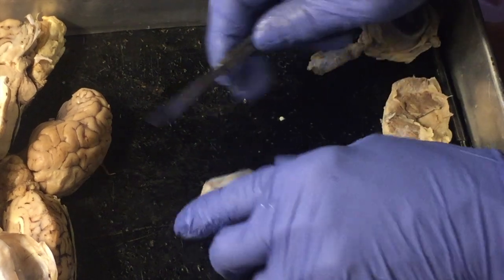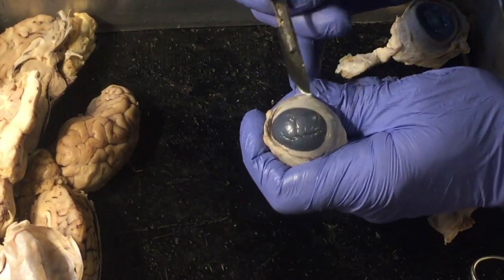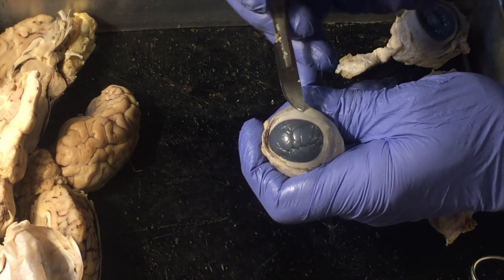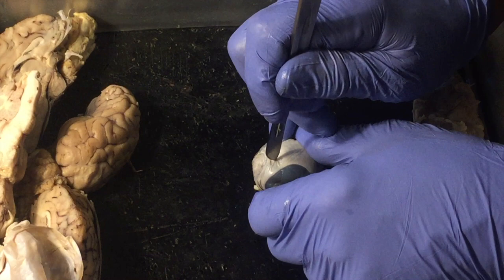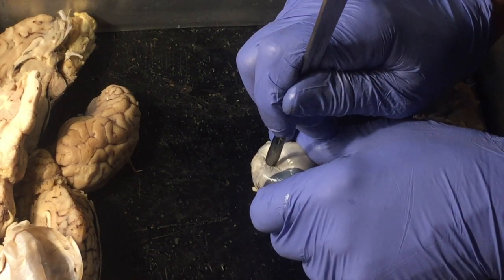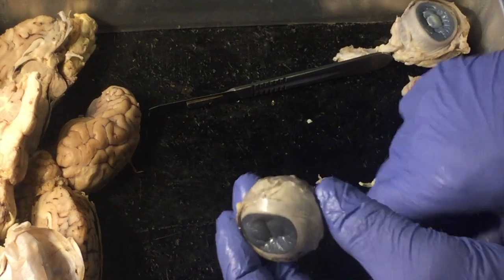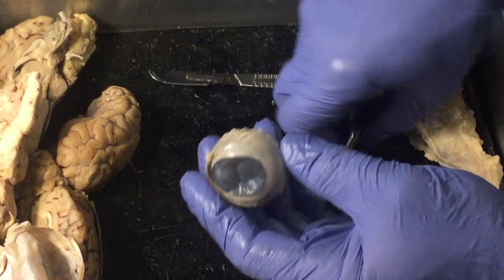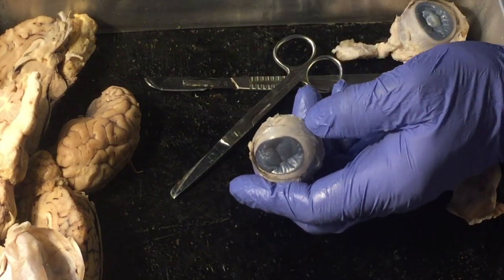So what I'm going to do is about a 1/4 inch away from or into the sclera, I'm going to cut maybe 1/8 of an inch. I'm going to cut in, and it's going to pop. There's going to be some goosh of fluid as I make that cut. That's because there's fluid in the eyeball, and the amount of fluid in the eyeball helps dictate its shape. Actually, I think I'm going to take the smaller scissors here.